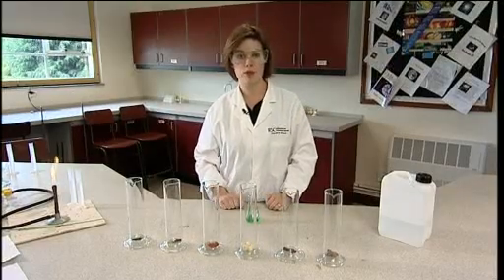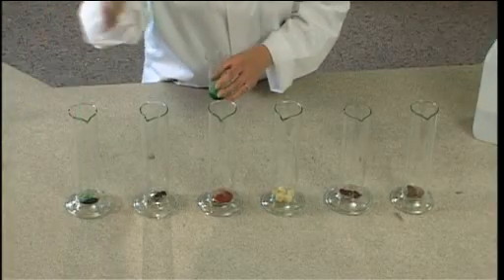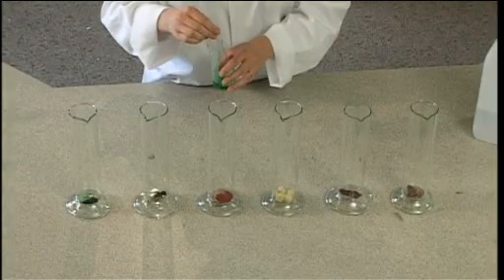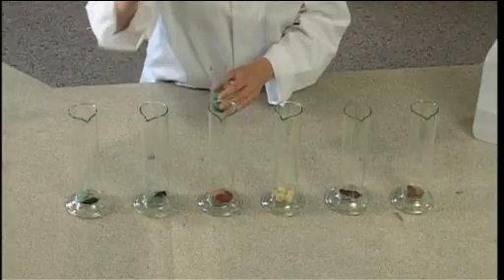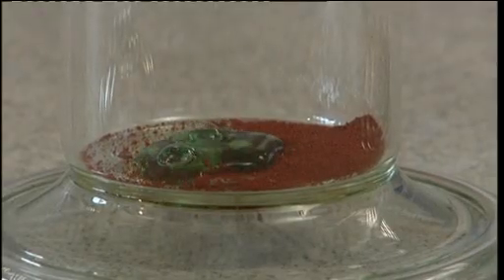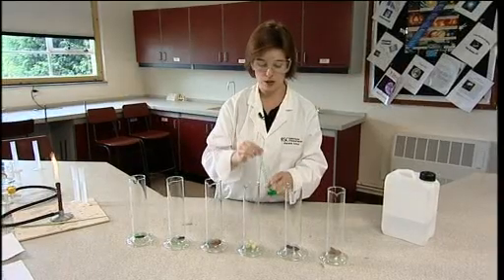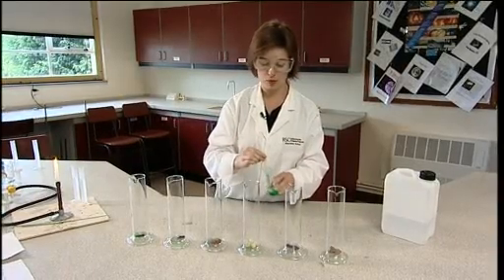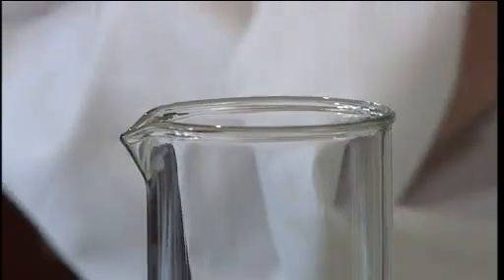The liver needs to be boiled in water for about five minutes. To each of these, add one centimetre cubed of washing up liquid. It doesn't need to be measured accurately, but you need to use the same amount each time to ensure that it's a fair test. Avoid spilling the washing up liquid down the sides of the tube, and the catalyst also needs to be at the bottom of the tube and not down the sides.